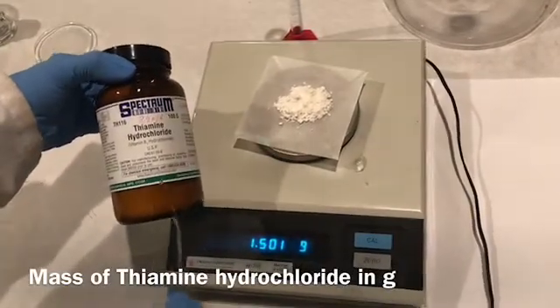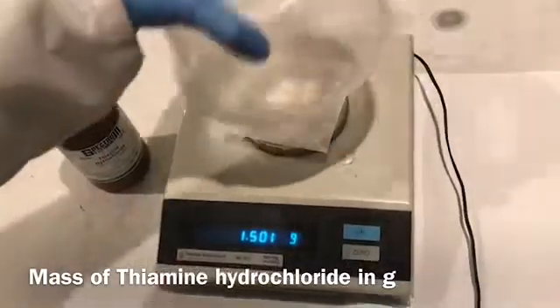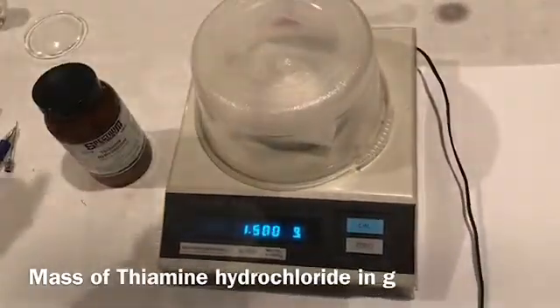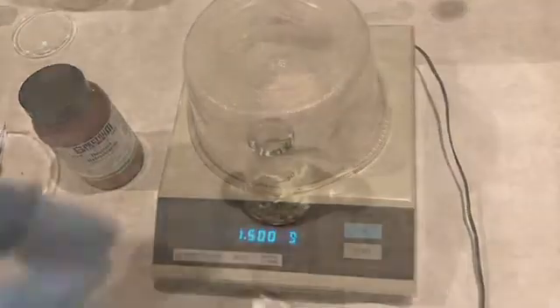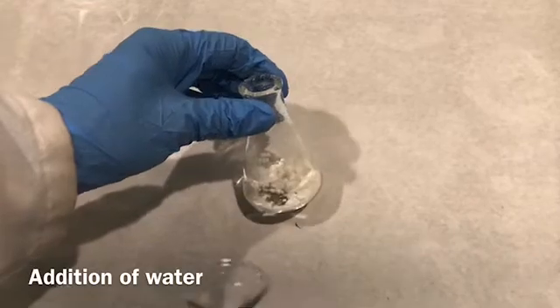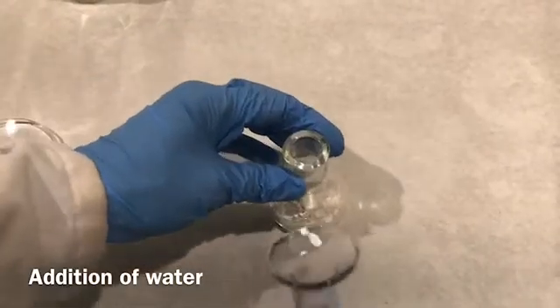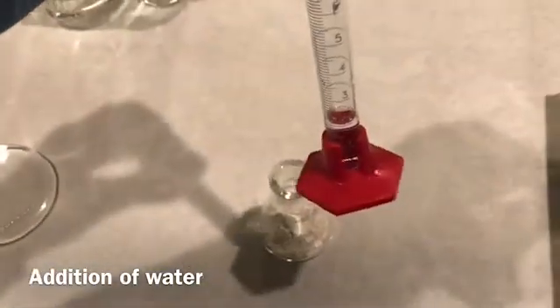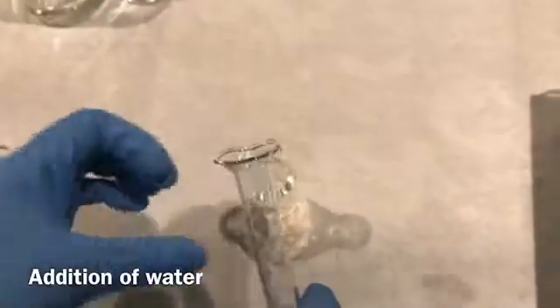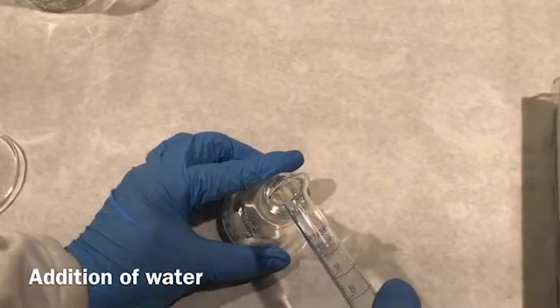Here I weighed 1.5 grams of thiamine hydrochloride — note down the weight. Now I transferred the thiamine hydrochloride into a 50 mL Erlenmeyer flask, along with 2 milliliters of DI water, and I am going to dissolve it.